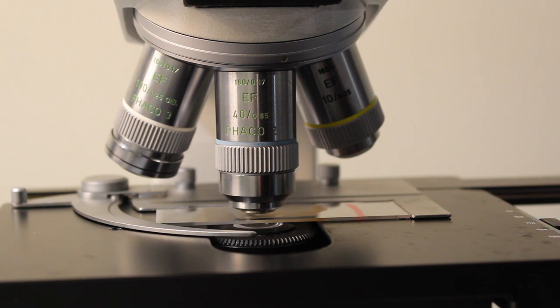So that is the basics of focusing your microscope and changing lenses. How to safely use your high magnification oil lens is an important topic worthy of its own episode. So join me in episode 4 for discussion on how to safely use an oil objective lens.